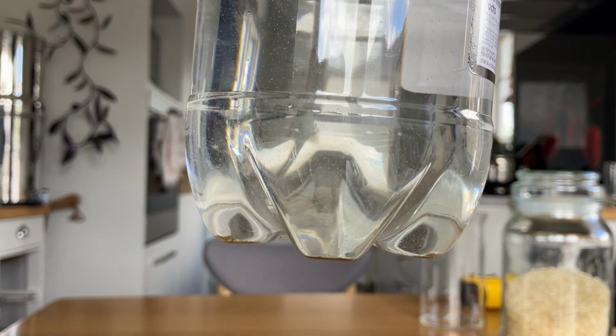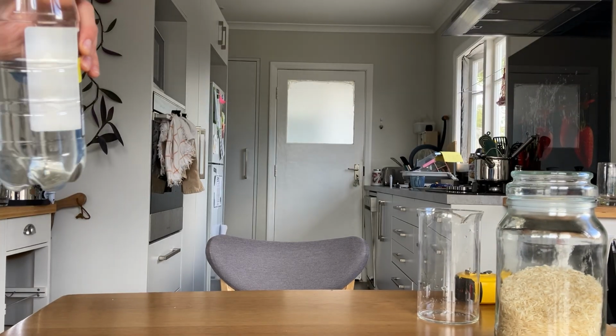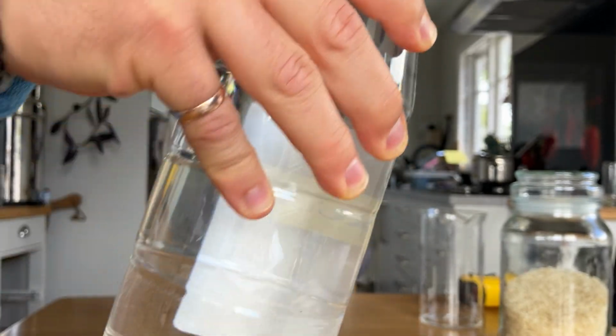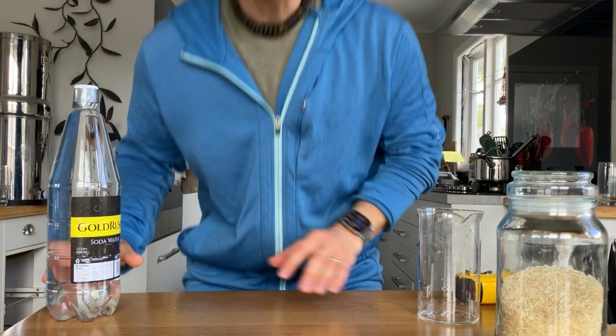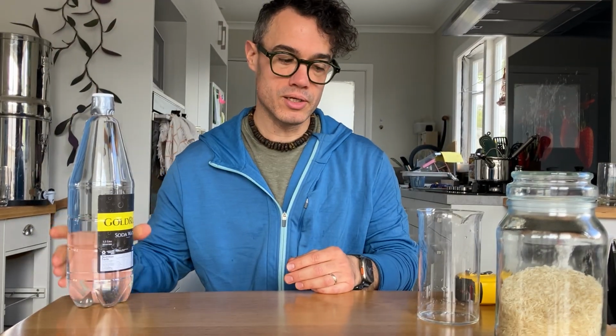And that's largely due to the way that I collected the water. Since the hole of this is pretty small and I submerged this into the river, you saw that in the previous video, we're just not gonna collect as much sediment into this container as we would if we were to get like a bucket and submerge that bucket into moving water in the river.